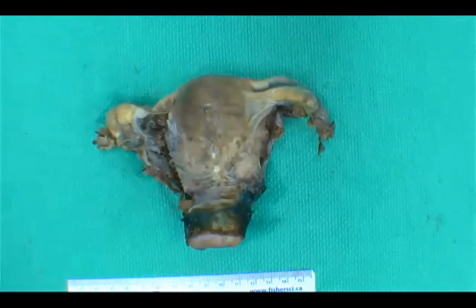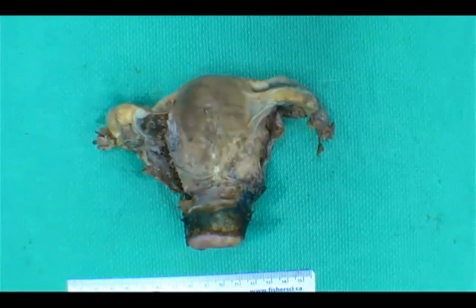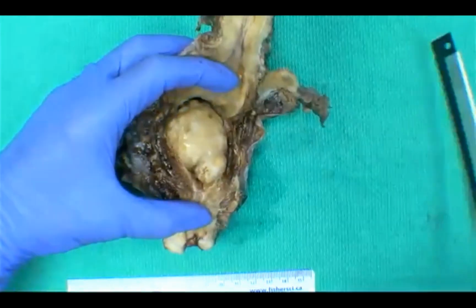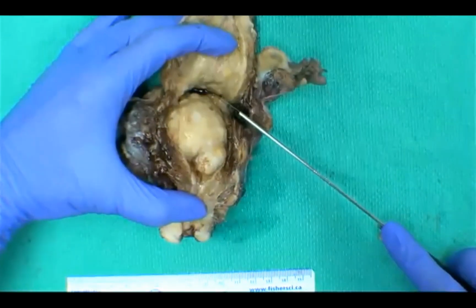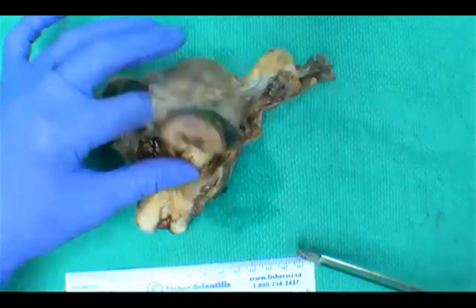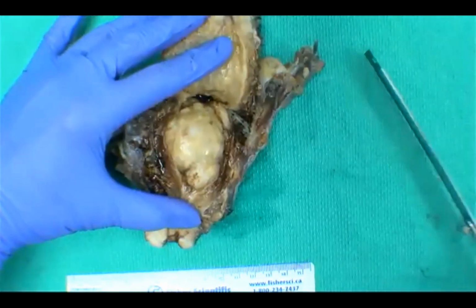I think people have mentioned some potential candidates, right? The most popular one being a fibroid. And just because we're trying to be opportunistic as much as possible here, if you haven't seen a fibroid, it has a very distinctive surface cut to it. Hopefully we will be able to see. Again, always safety first when it comes to these things, dealing with very sharp things.